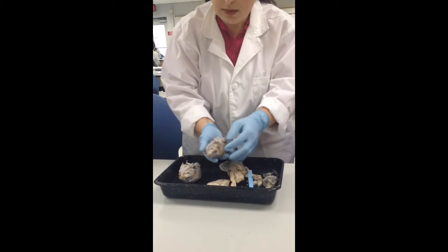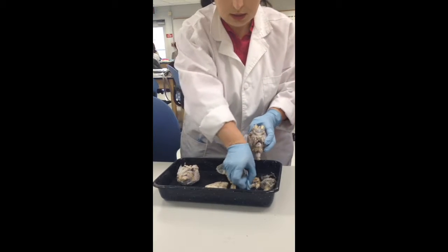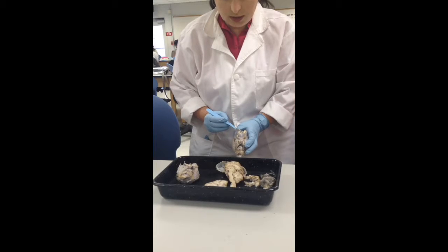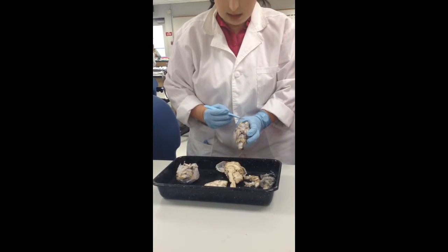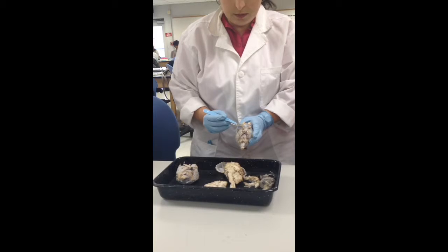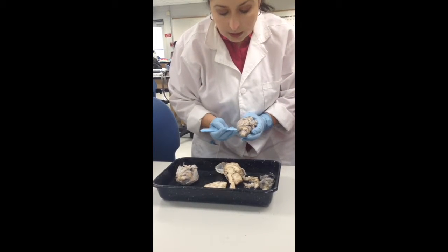Then you've got your brainstem going. You can see some blood vessels, and you can also see some cranial nerves. So what cranial nerve is this? Olfactory. And their olfactory bulb is much bigger than ours, right? Because they rely on the sense of smell. This is a sheep brain. And then what cranial nerve would this be? Optic.